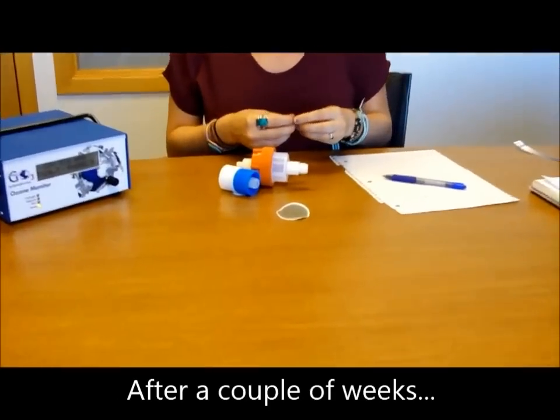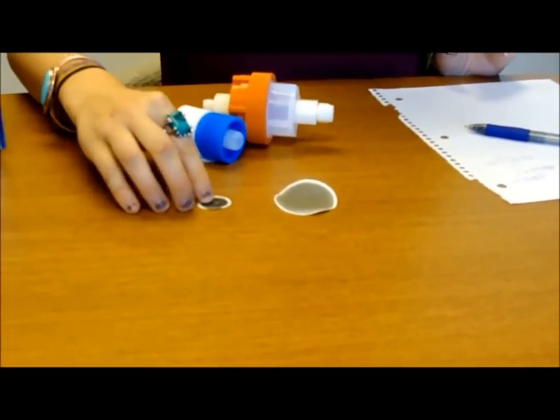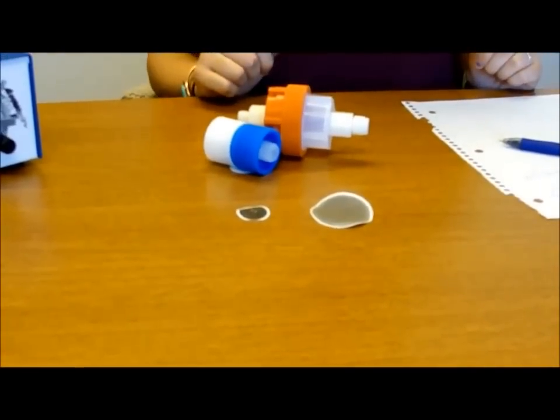Now if you come back and the filters are still white inside, wait and come back in another couple weeks. But eventually you'll unscrew it and it'll look like this, or this one if you have the smaller filter housing.